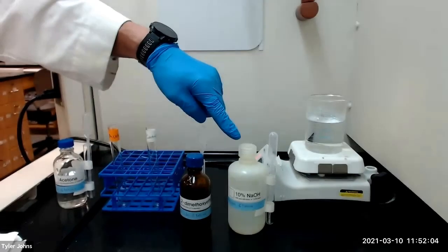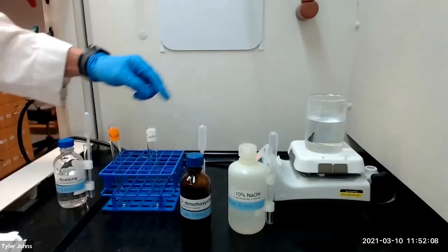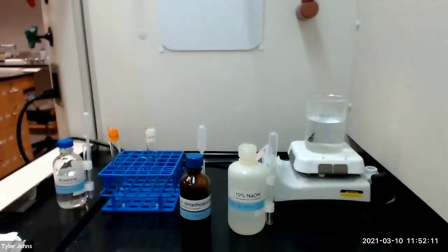We will then add 2 milliliters of 10% sodium hydroxide solution and place the test tubes in a 60 to 70 degrees Celsius hot water bath.